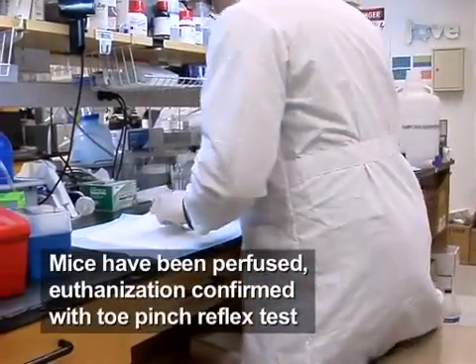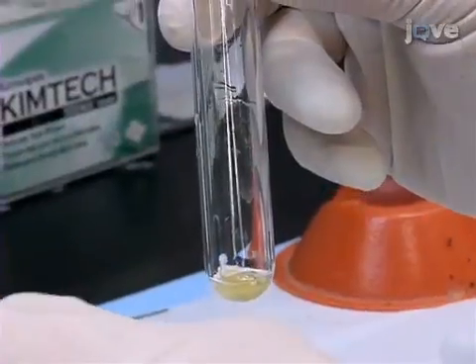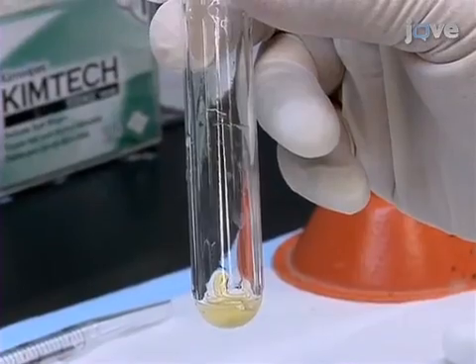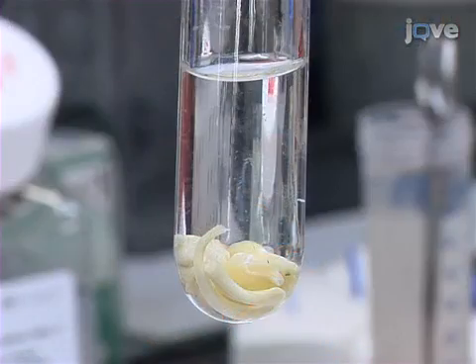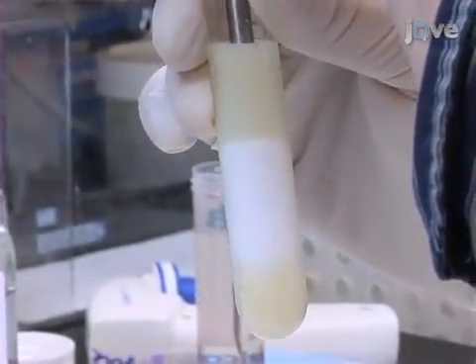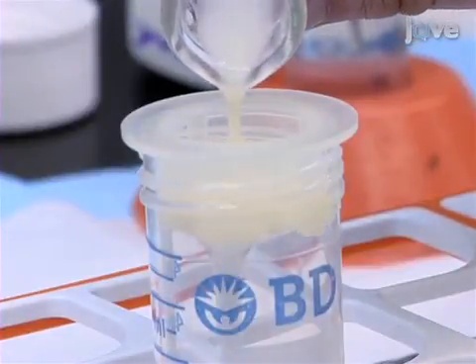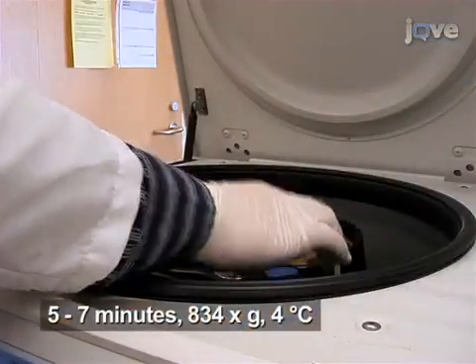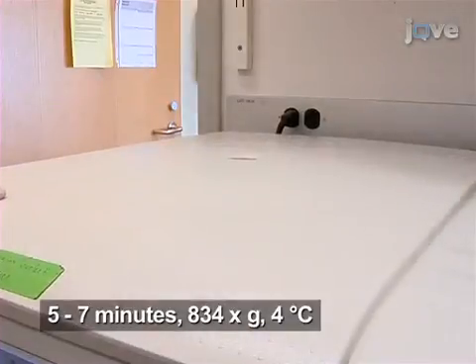After perfusion of all the mice, dissect the brains and spinal cords. Then, place one brain and one spinal cord at a time into a 15 milliliter Dounce homogenizer, adding 5 milliliters of PBS to the tissues each time. After performing 10 to 20 gentle strokes, pass the homogenates through 70 micron cell strainers into individual 50 milliliter conical tubes and centrifuge the tubes for 5 to 7 minutes at 834 times G and 4 degrees Celsius.